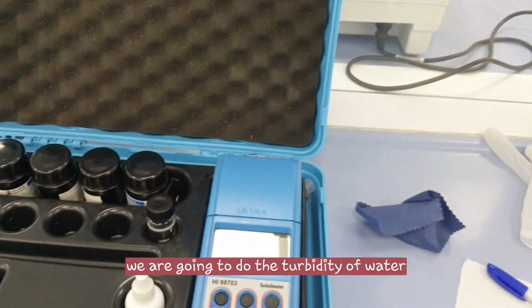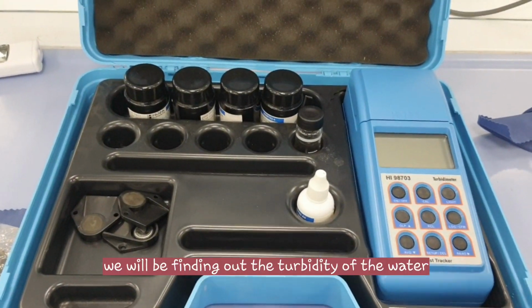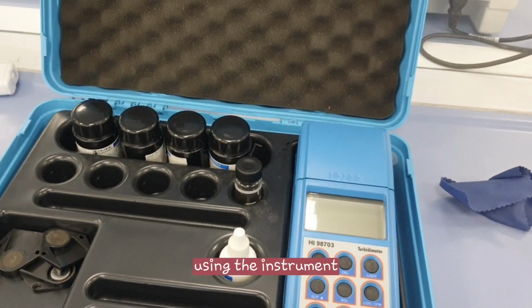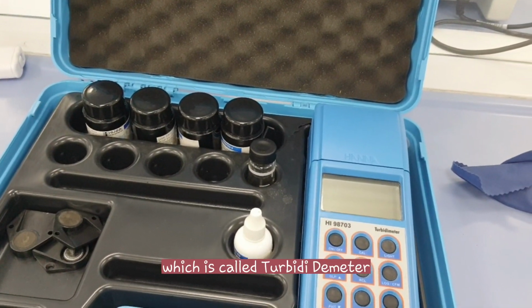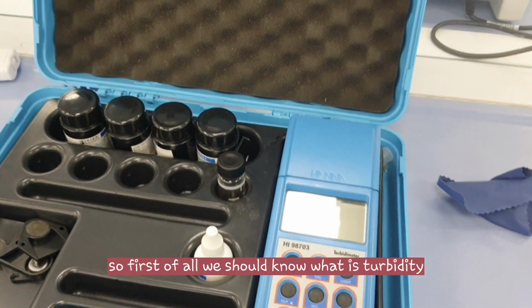Hello guys, today we are going to do the turbidity of water. In this experiment we will be finding out the turbidity of the water using this instrument called a turbidity meter, and the brand name is Hanna. First of all, we should know what turbidity is.